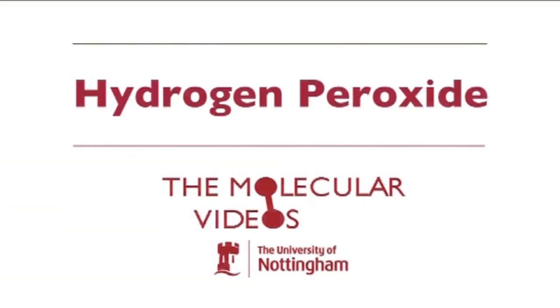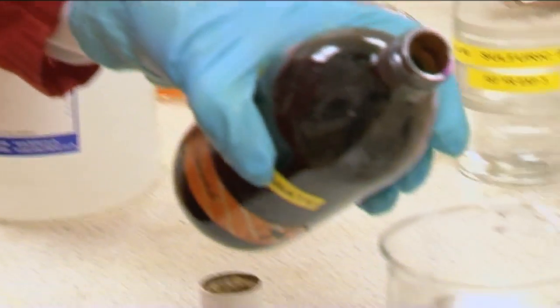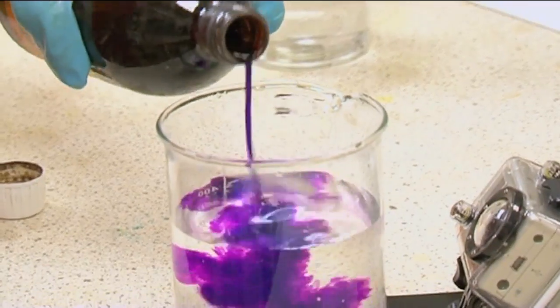I'm now going to do one of my favorite reactions. It's not very spectacular, but I think it's very satisfying. It's the reaction between hydrogen peroxide and potassium permanganate. Let's begin with a bit of water. So I'll add some potassium permanganate, which gives it a nice pinkish-purple color.